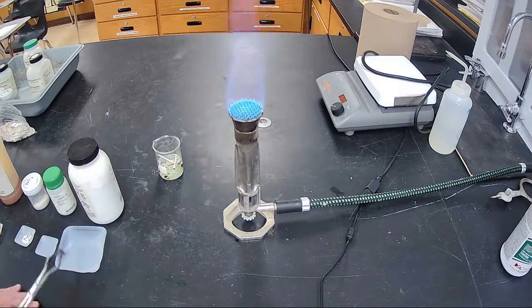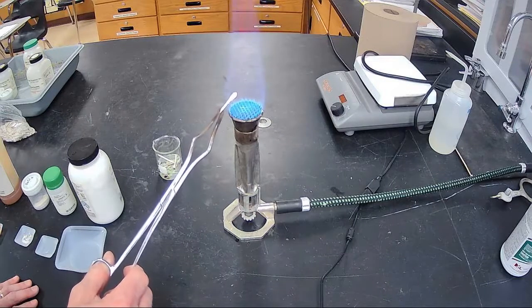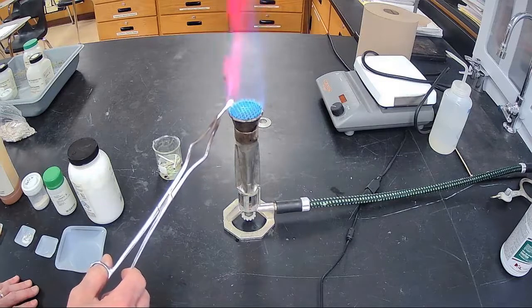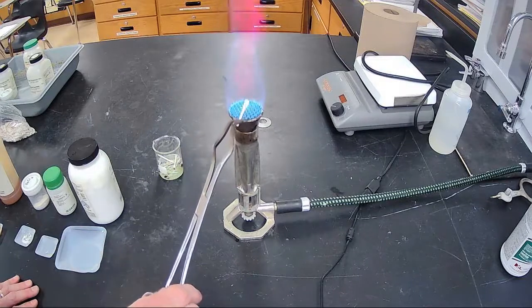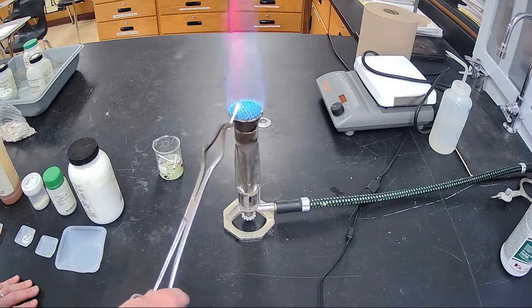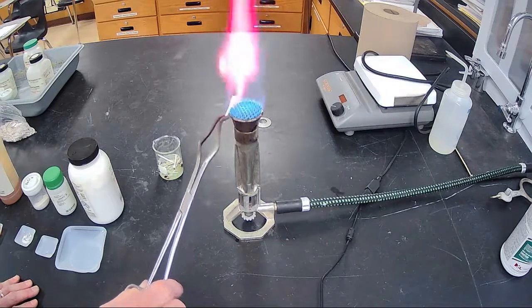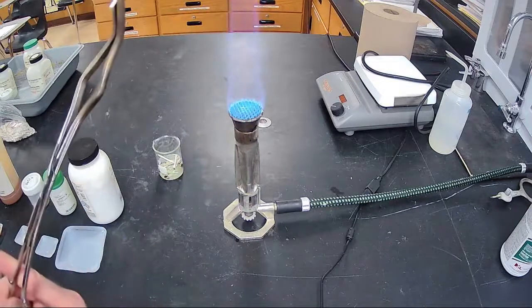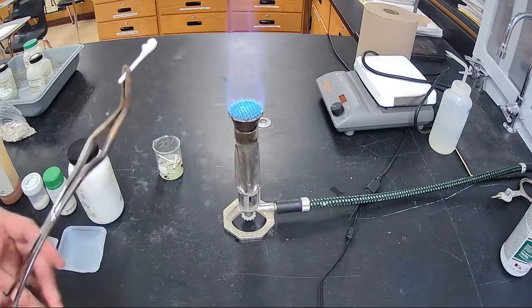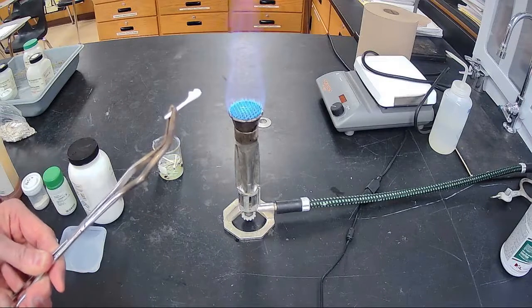Okay, and the last one, number 9. Hope you can see that one. As that starts to burn, the water starts to burn off. The salt catches on and starts to ignite. Really nice deep dark red here. Some of the salt evaporating, popping it off there. You can see there even salt crystals forming on the edge of that. I don't know if you can see that. If you look there, you can see it really good there.